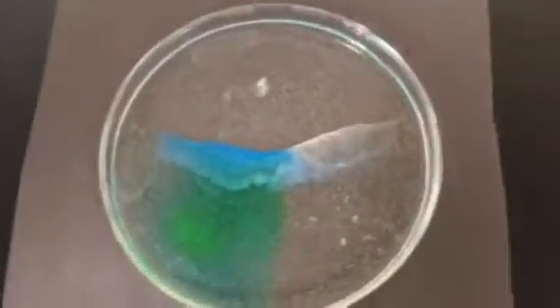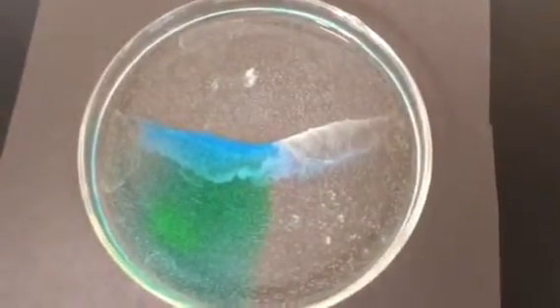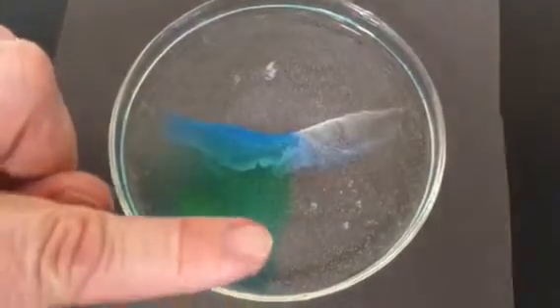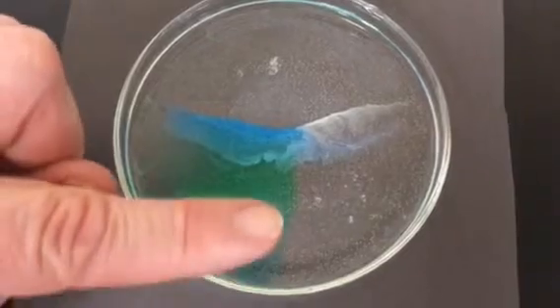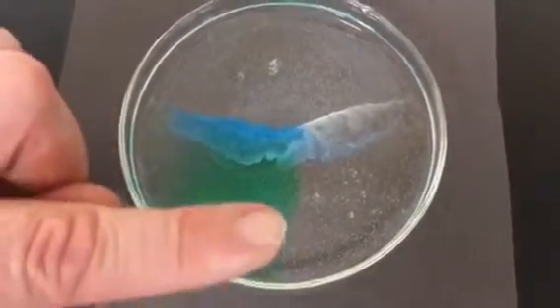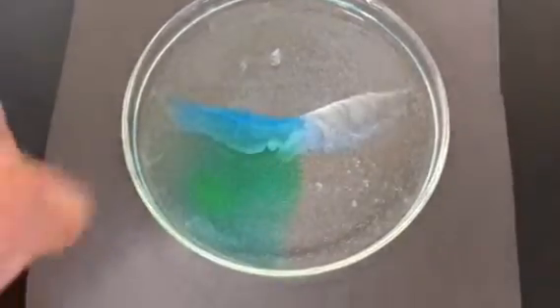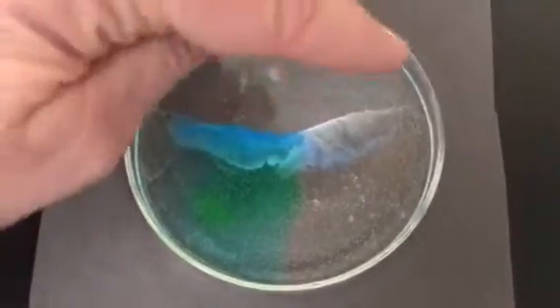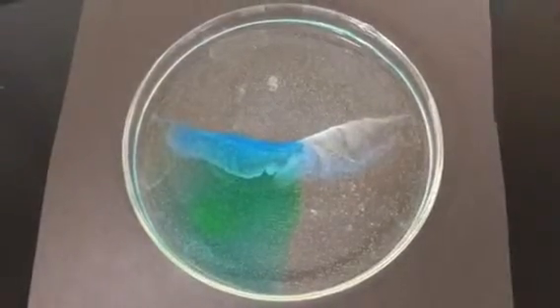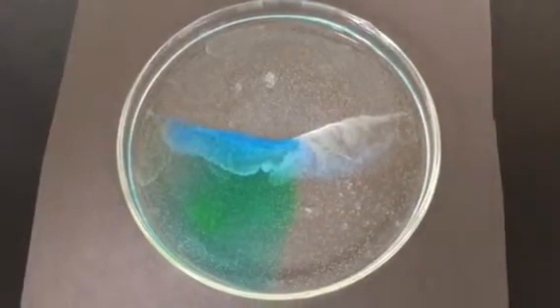Let's go back to the second one again and see what that's looking like. Now you can very clearly see, look along here, that there's no cloudy line where these two are mixing, the copper and the calcium salt. There's no line formed. But along here you see a line formed, and you see that there are two different colors to it. You need to think about all of this.